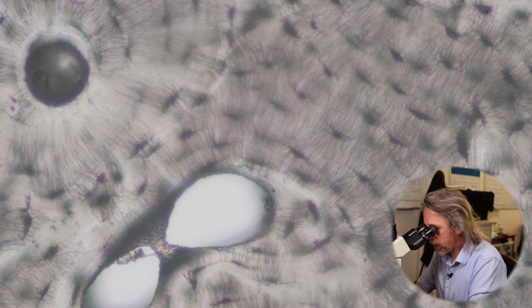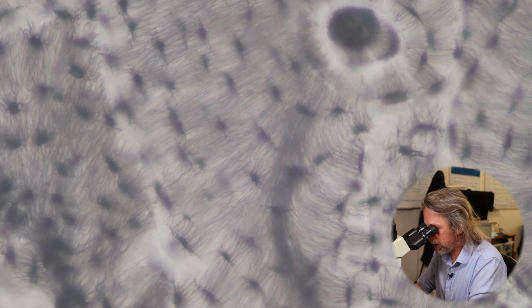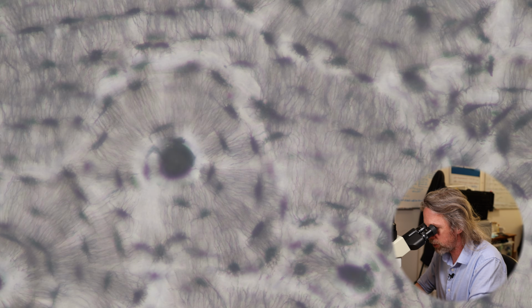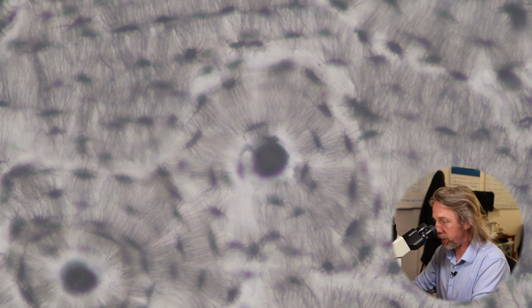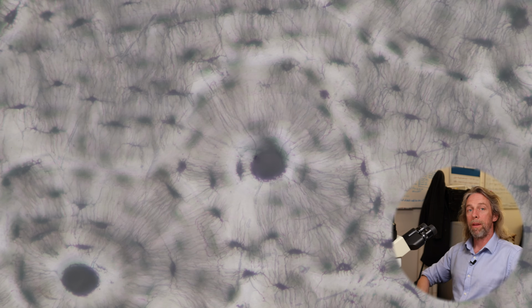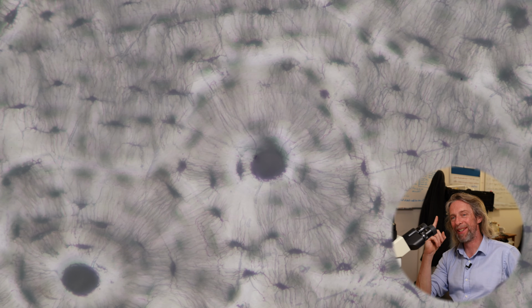But let's find a tidy one. That tidy one? It's a pretty tidy one. Yeah, as you can see, compact bone is very compact, and it's all osteons up against osteons. This is the structural unit of compact bone, and I know that you think that this is probably the most amazing bit of histology you've seen yet, but just you wait.